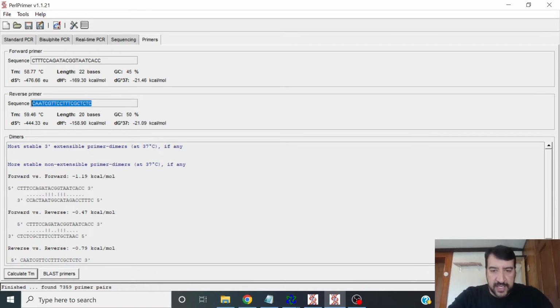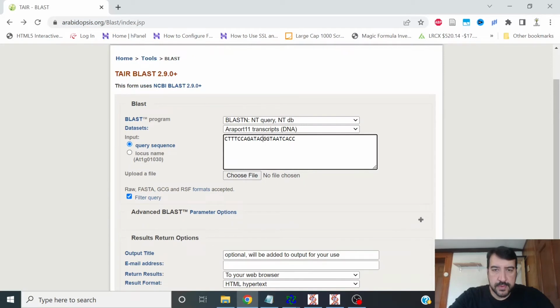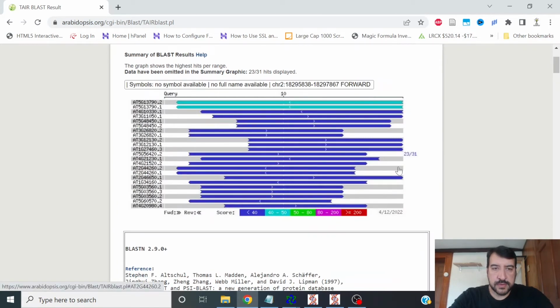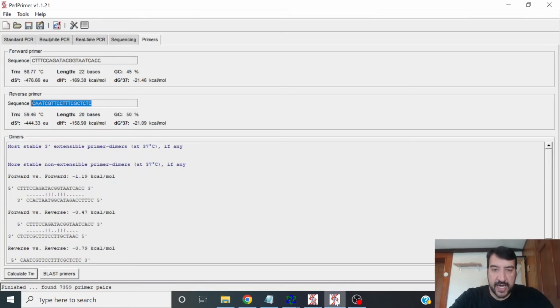At least one of these two should be specific. And you can see here again that the only perfect match is with AGL15 again. And so this second primer pair would actually be our desired primer pair to use. And these are almost virtually guaranteed to give you very nice results with qPCR.